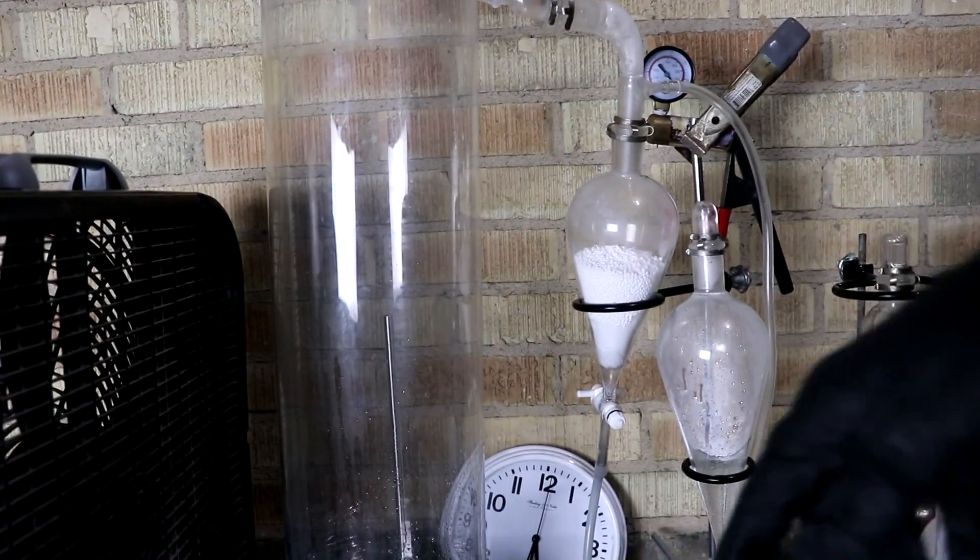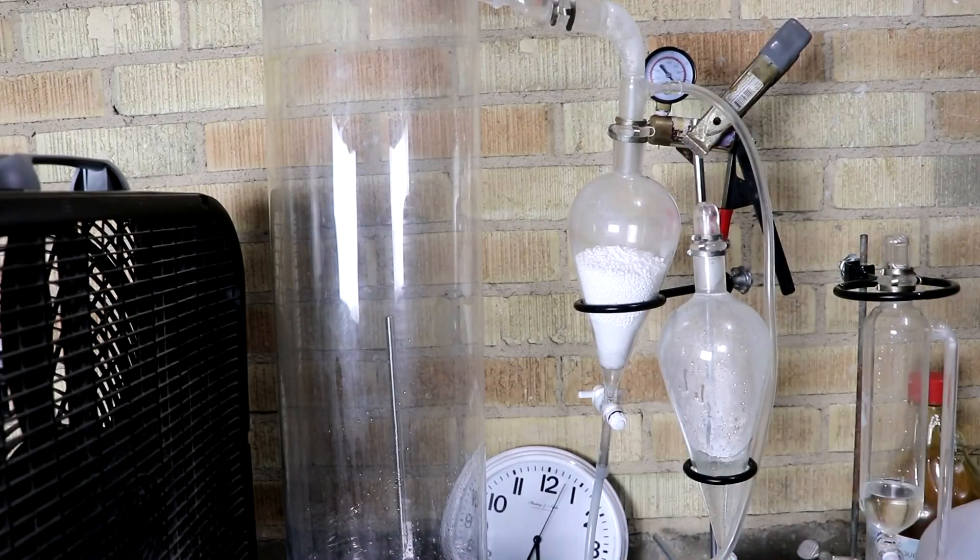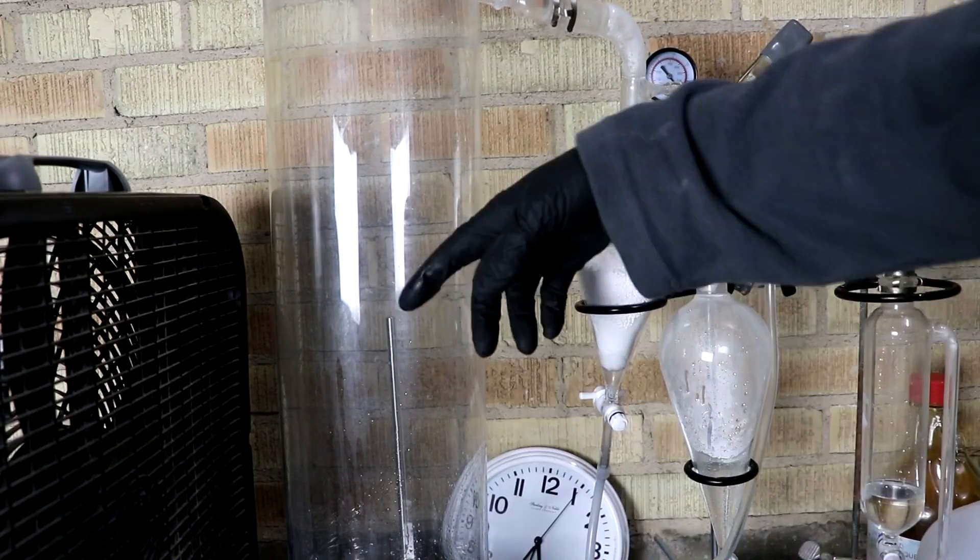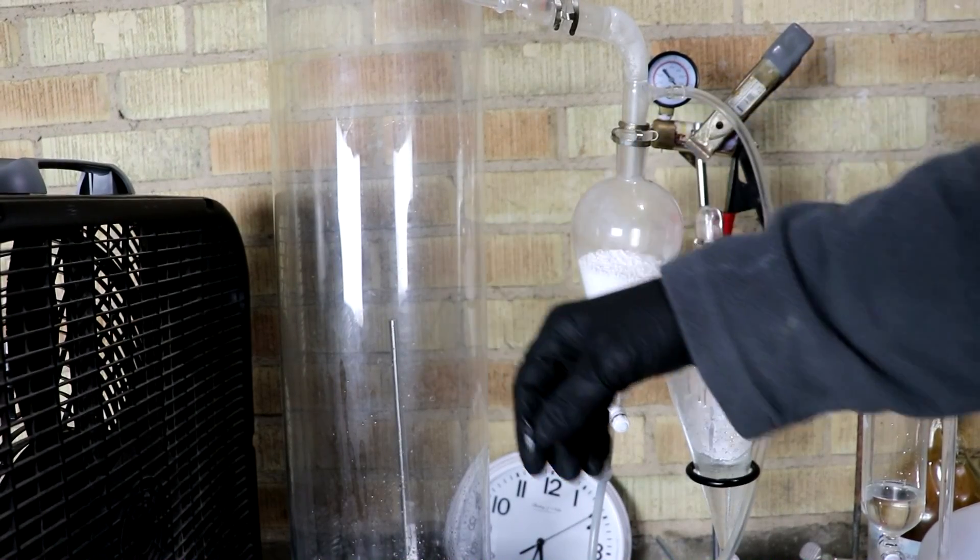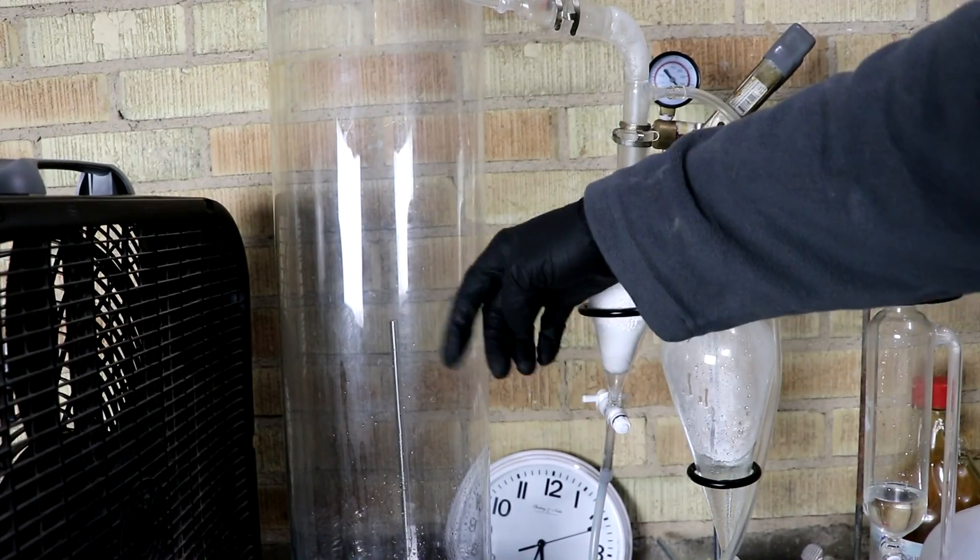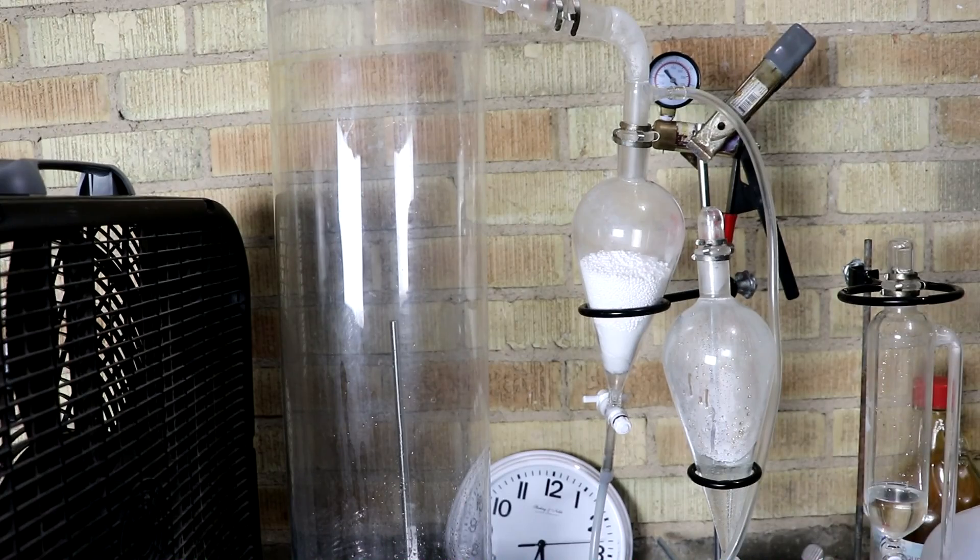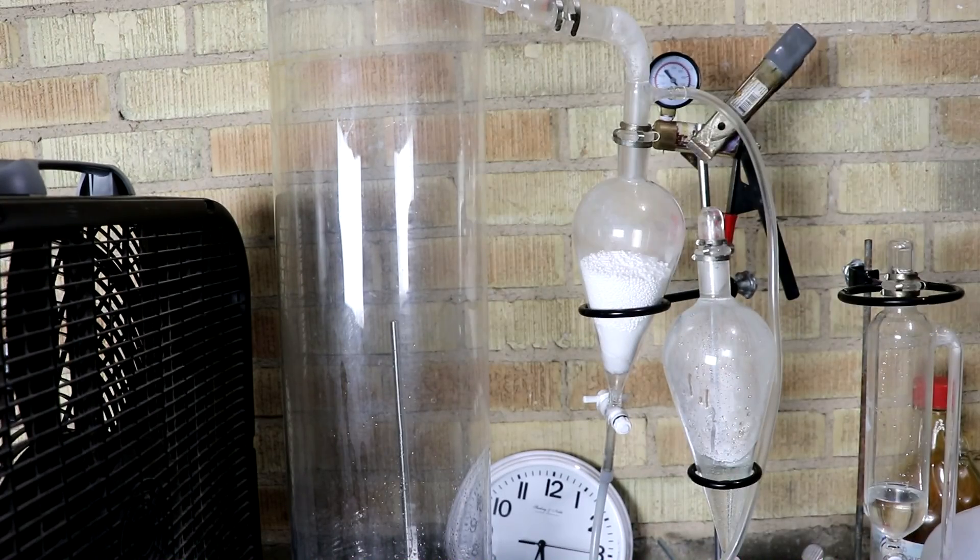Now the chamber is full of air currently. That is not a huge problem, but it is a little bit annoying because the nitrogen is taking up a lot of volume. In fact, there's only about 20% oxygen in there right now. The nitrogen isn't going to do anything for this reaction.